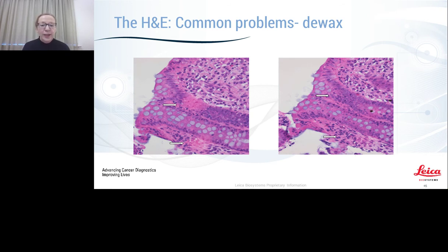It's always worth cutting the section again if you do see some issue. As you can see on the left, there are two eosinophilic patches that do not exist in the same tissue on the right. And that's purely because there is residual wax left in the tissue.